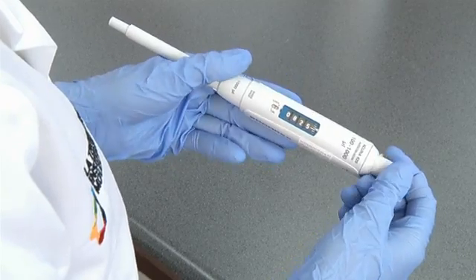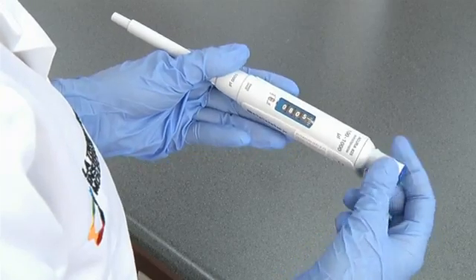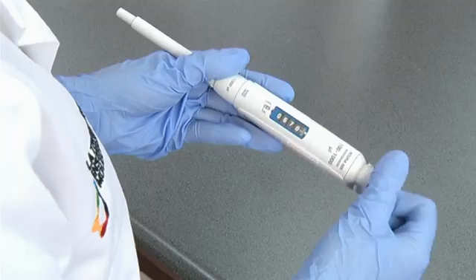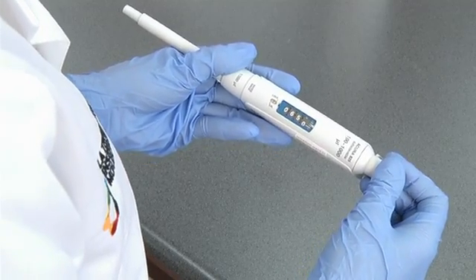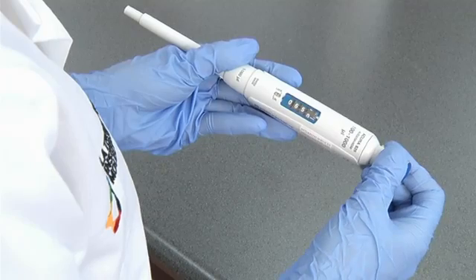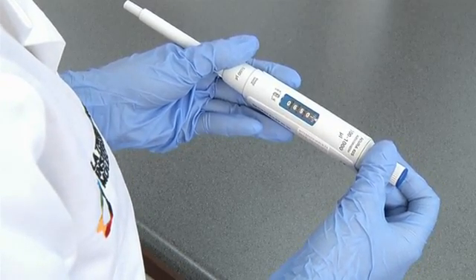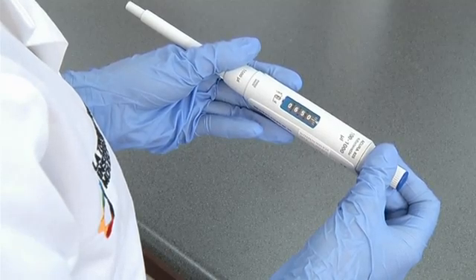The volume of the pipette can be set by rotating the plunger, clockwise for decreasing the volume and anticlockwise for increasing the volume. It is very important not to attempt to wind the volume past the maximum or minimum volume for the pipette. The volume here has been set to 650 microliters.